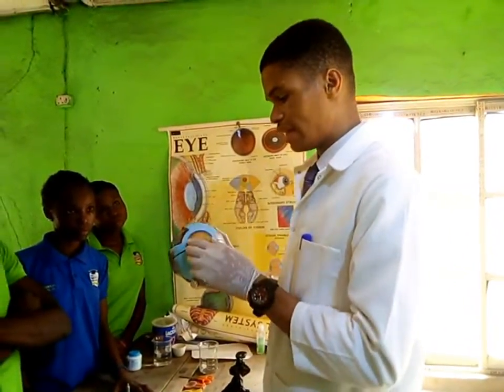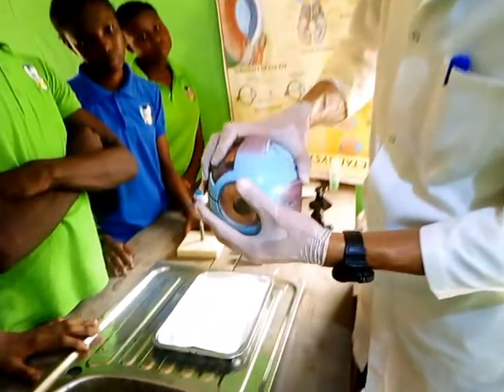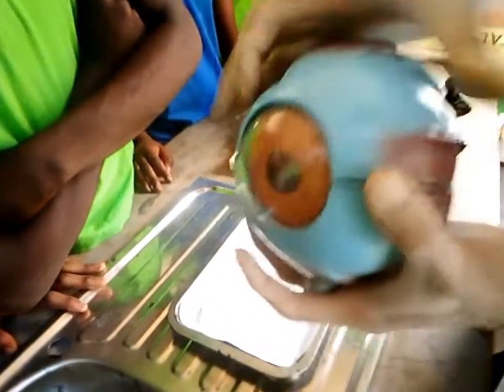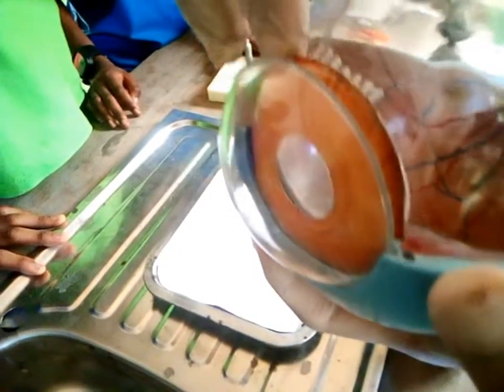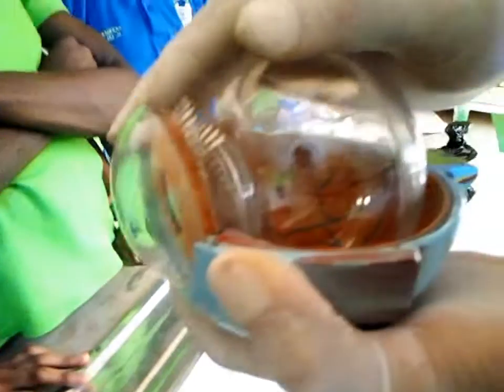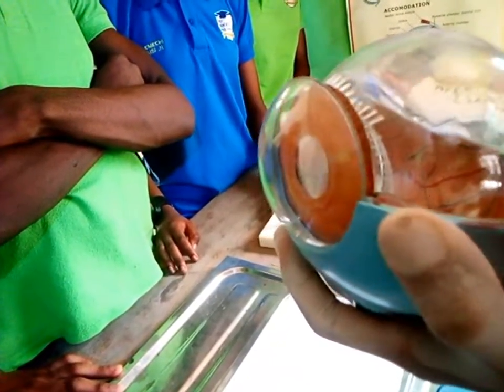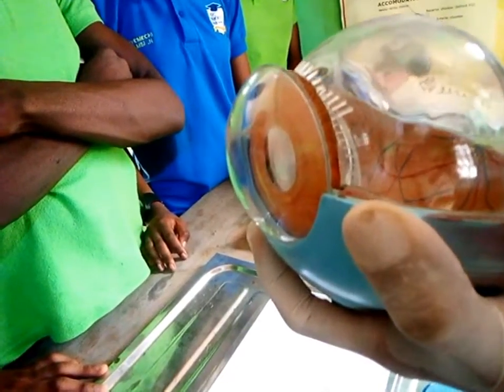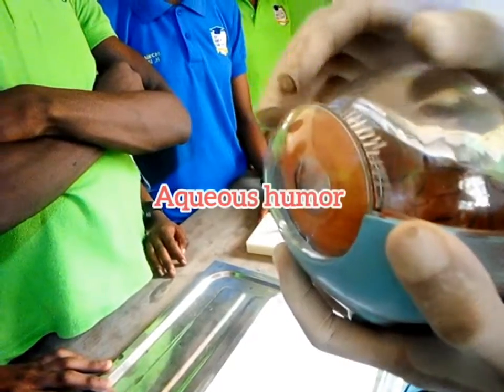Now there's another part that I didn't mention. Here in this area before the iris, are you getting me? This space is filled with a liquid. Are you getting me? A liquid that is kind of viscous. What do I mean? A thick liquid. Do you understand? But not that thick, but it's a liquid. Now the liquid is called aqueous humor. Do you get that?